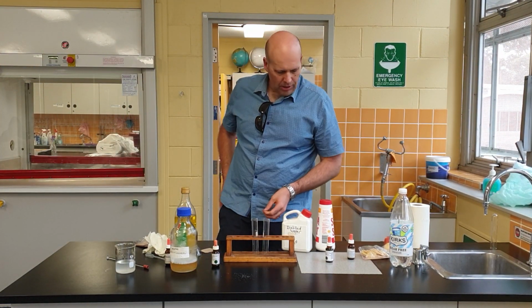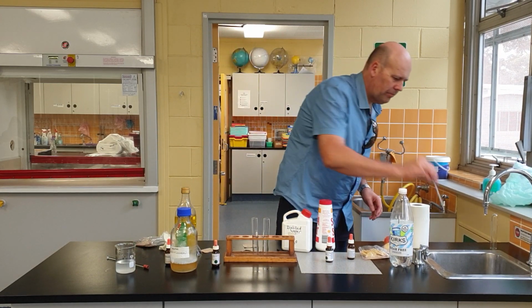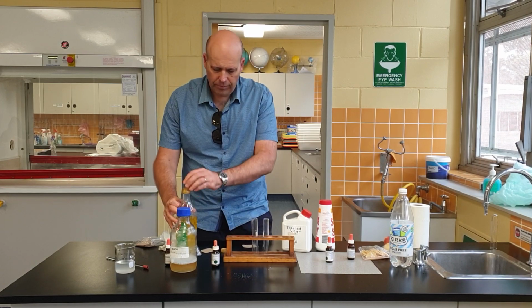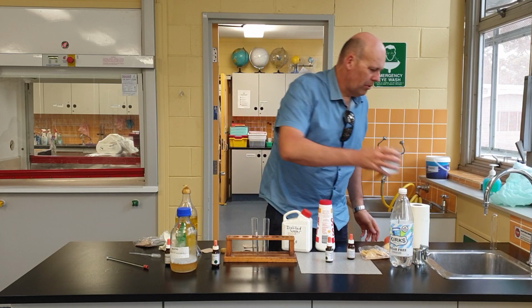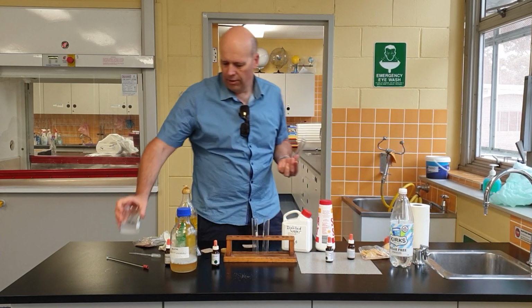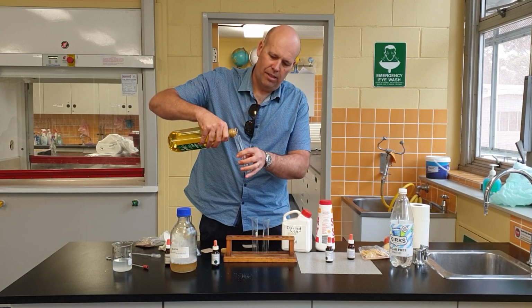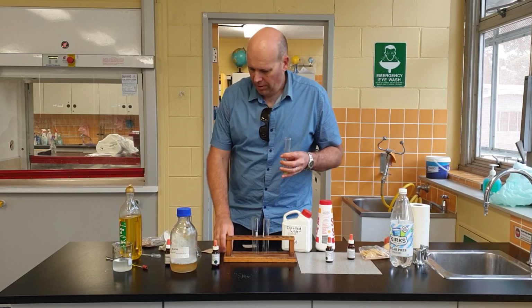Now I'm going to do the same thing, but this time I'm going to use some oil. So I'll get my oil, and I'll put some oil into here. A little bit of oil in there.